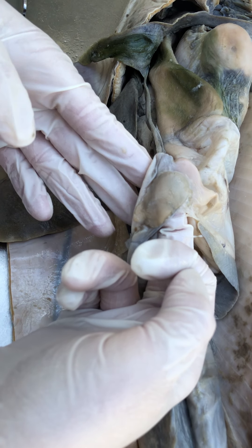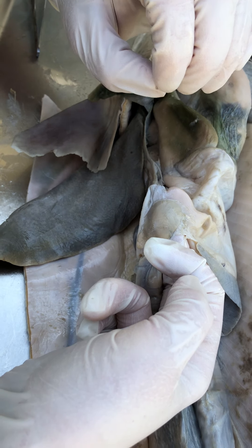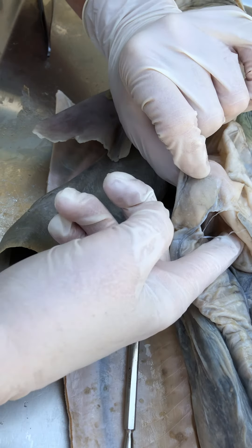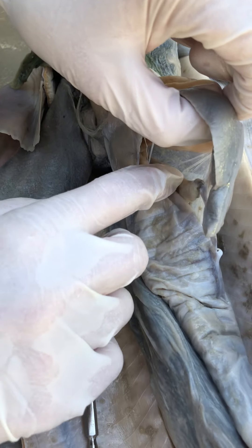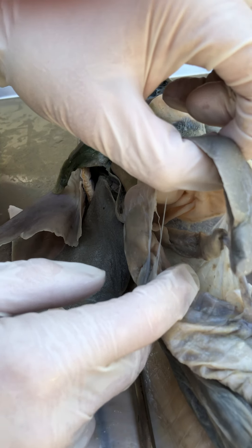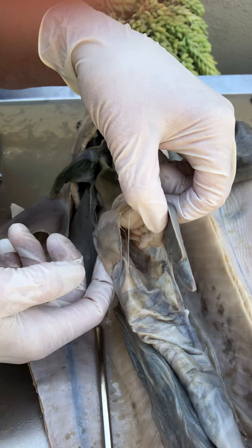Just like in the pig, we have another glandular secretory organ with a duct secreting right into the intestine — that's the ventral lobe of the pancreas. To find the dorsal lobe, pick up the stomach, admire the spleen, and there is the dorsal lobe of the pancreas with the mesenteries. The ventral lobe runs along the duodenum, just like in the pig and in us.